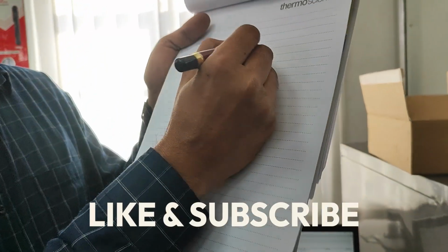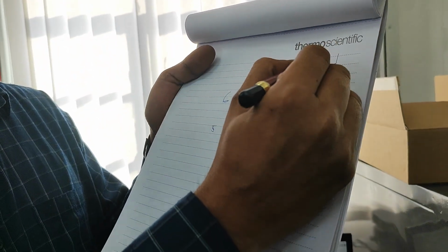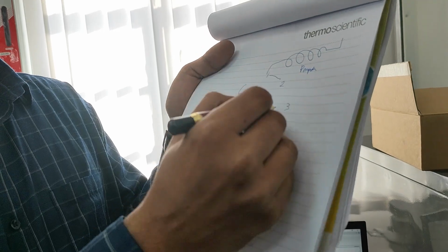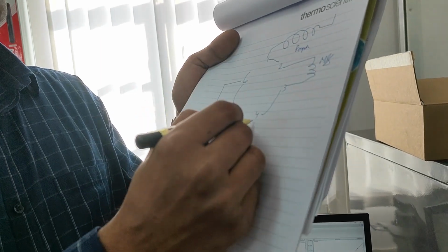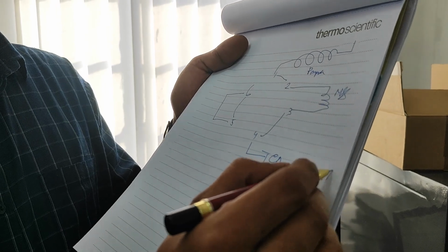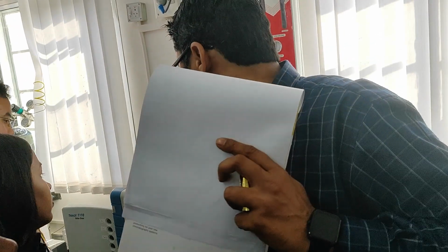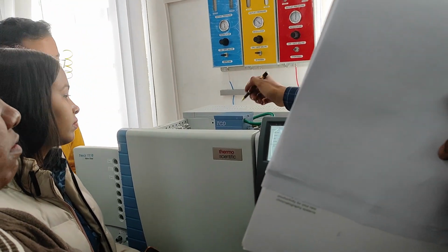Take a notebook and pen. Code the valve here, right? 1, 2, 3, 4, 5, 6. Before that, we have to do the Porapak column. And 2, 3 is the MS molecular sieve column. 4 is going to the TCD. Right? After the TCD, it is going to the methanizer, then the FID. So this is the TCD, and the TCD outlet is taken here. It is going to this methanizer, then again from the methanizer to the FID. Okay? All are connected inside.